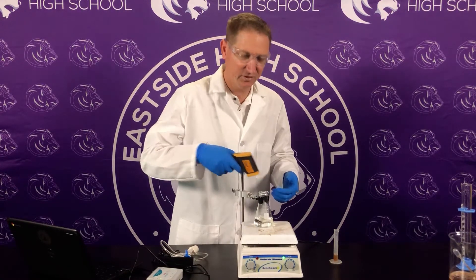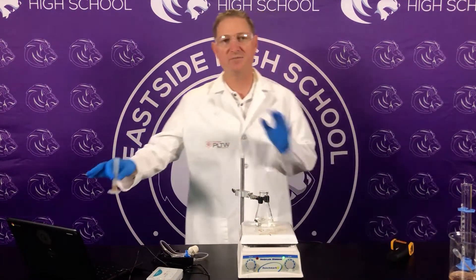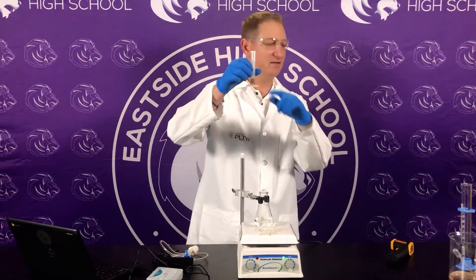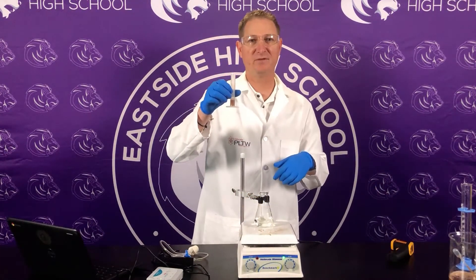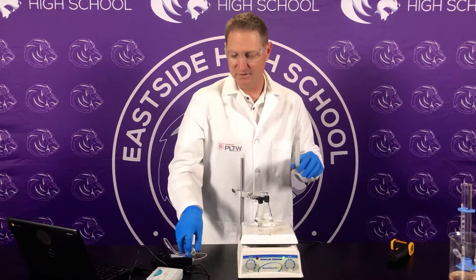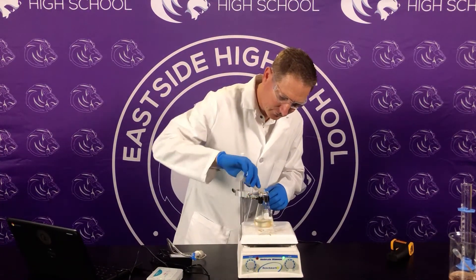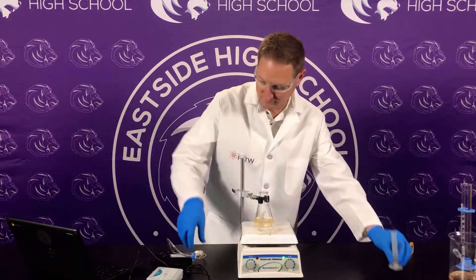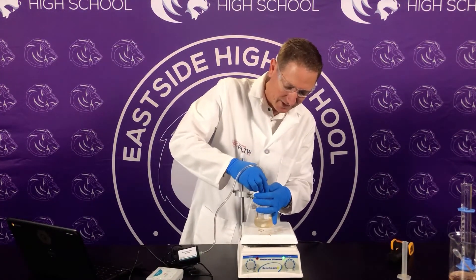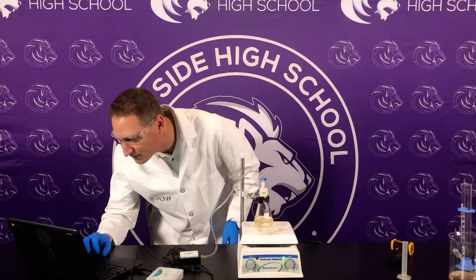We're getting a consistent temperature of 13°C. I have this set up for 200 seconds of collection. Two mls of the catalase that I created with potato and distilled water — I'm going to pour this in, secure the top as much as possible. We don't want any of that pressure released because that's what we're measuring, and collect.